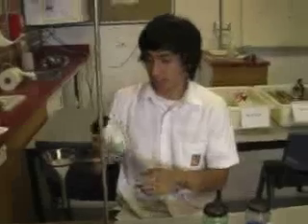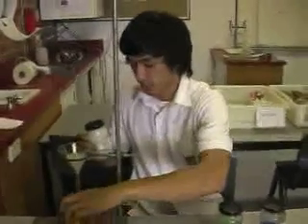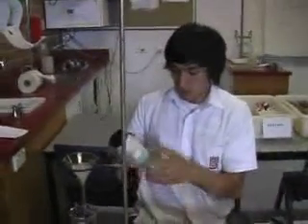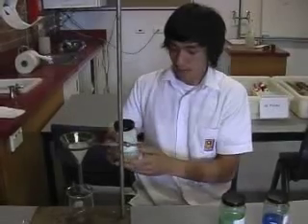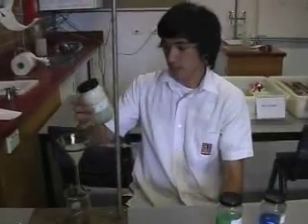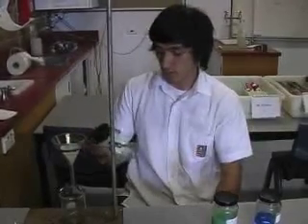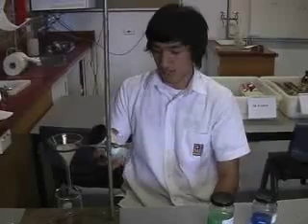This is the colloid and we're going to put this through the filter. Now what would you expect to happen with a colloid? Make a prediction about it. I'm not sure — I think it should all go through. Do you think it will all go through? Maybe a little bit. What sort of stuff is in it? There's water, detergent, and oil.